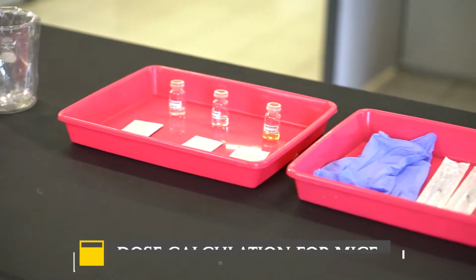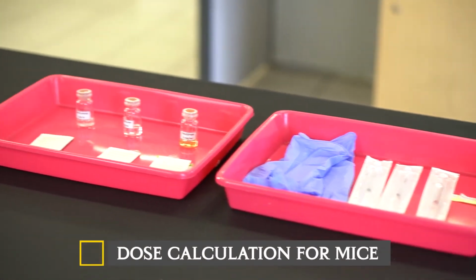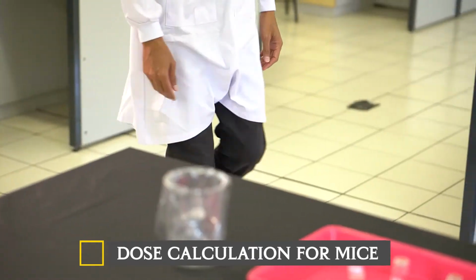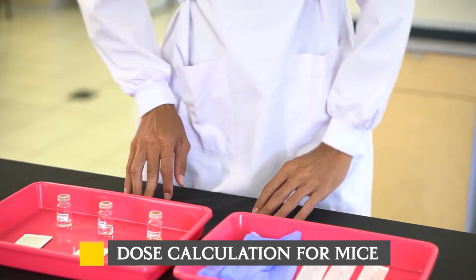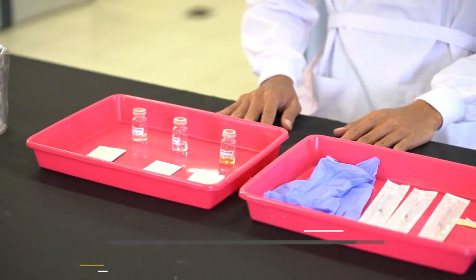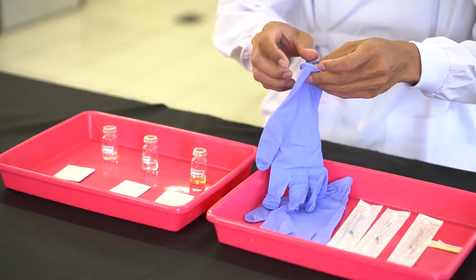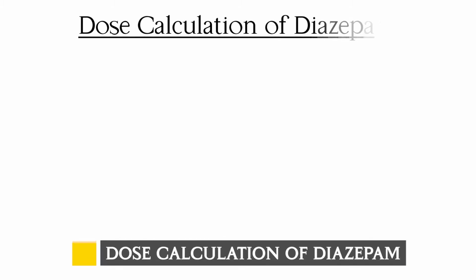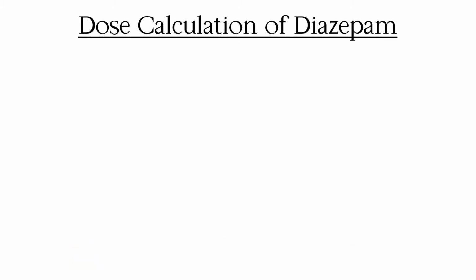Before starting the experiment, we need to calculate the dose of diazepam and midazolam as anticonvulsants and the dose of strychnine as a central nervous system stimulant for mice. Dose calculation of diazepam. Example of dose calculation: the dose of diazepam is 0.01 mg per gram.